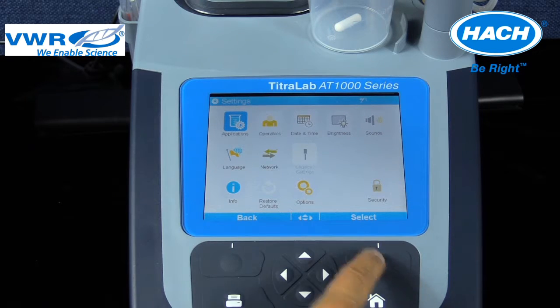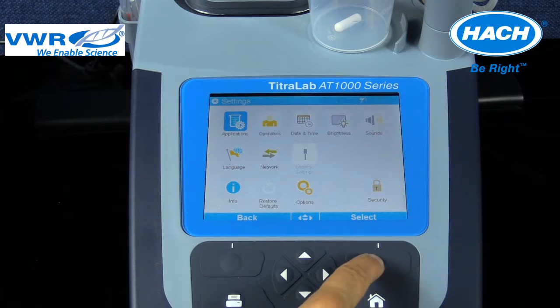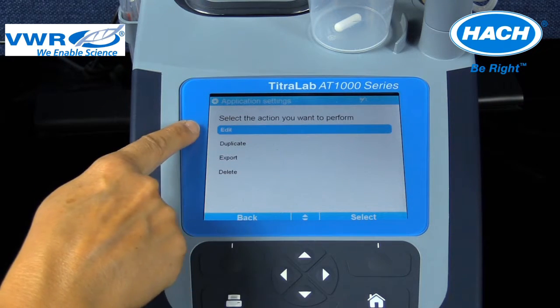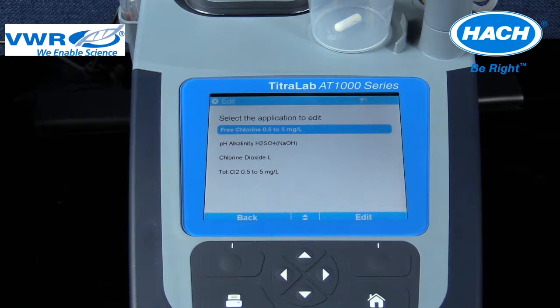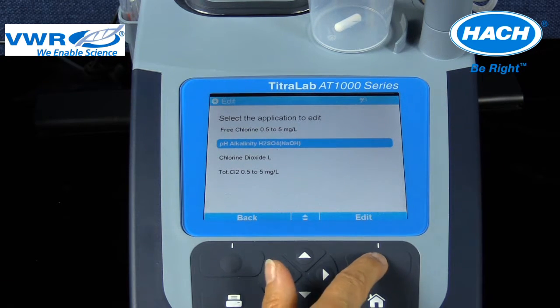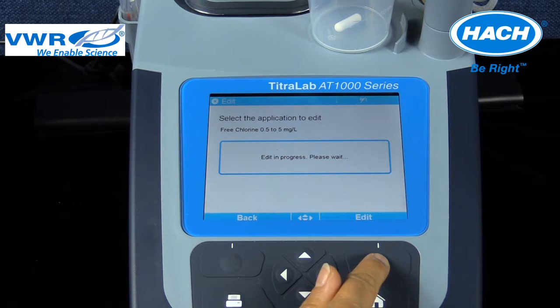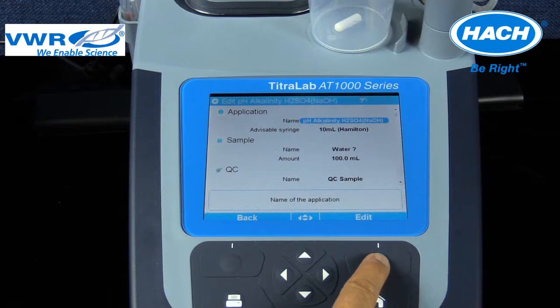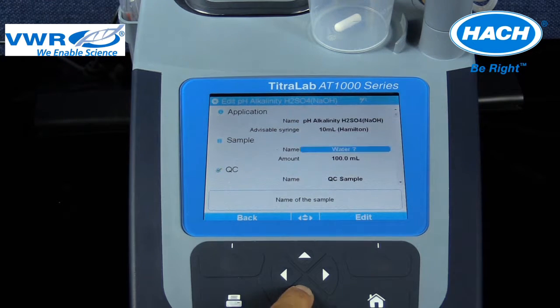Step 1: Select Edit on the application settings menu. Step 2: Select the appropriate application you need to edit. In this case, the pH electrode being calibrated is in the pH alkalinity application. Step 3: Scroll down to the electrode heading and the title PHC805.